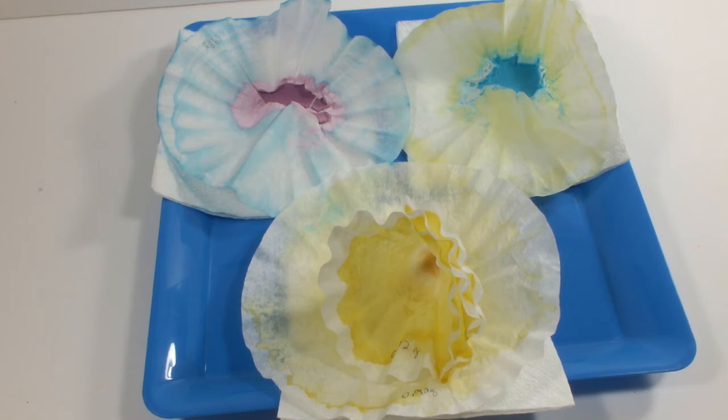For what it's worth, the cobalt was a quantitative yield, but I think it was biased a bit high with the copper migration. The copper was an 83% yield, and iron was, as I said, a pain to filter. There was quite a bit of loss, making the measured 23% yield not so surprising.